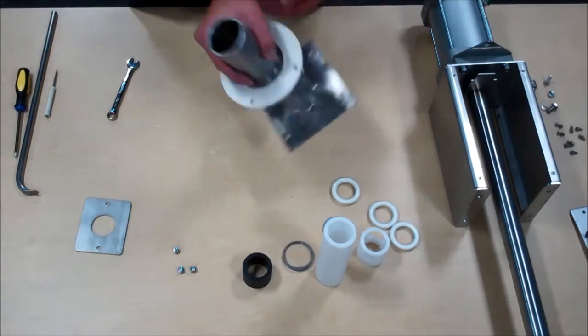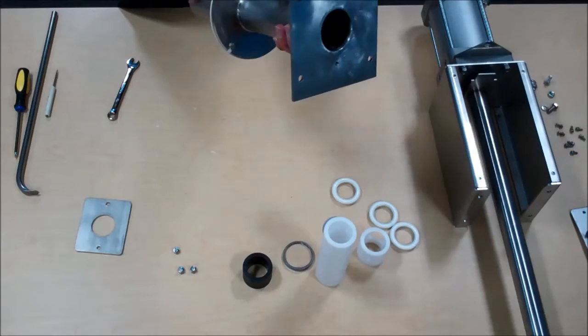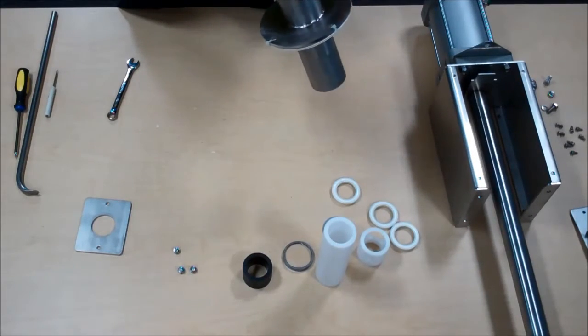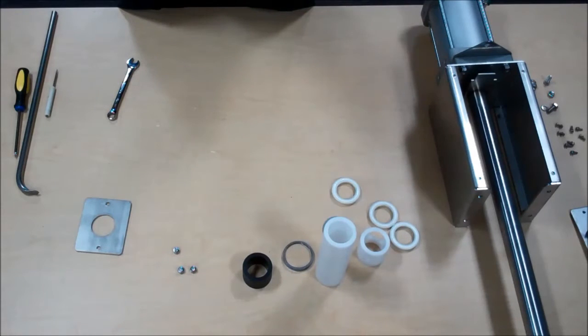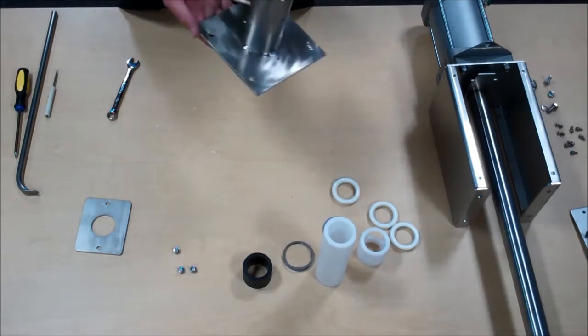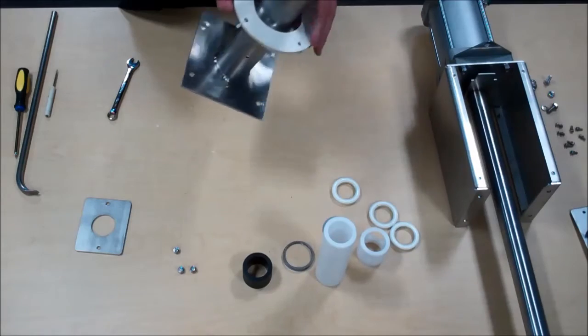After you remove all of the seals from the housing, some samplers have more seals in different arrangements than others. Please refer to your final assembly drawing or the drawing that may have came with your seal kit to verify the direction and orientation of all the seals.